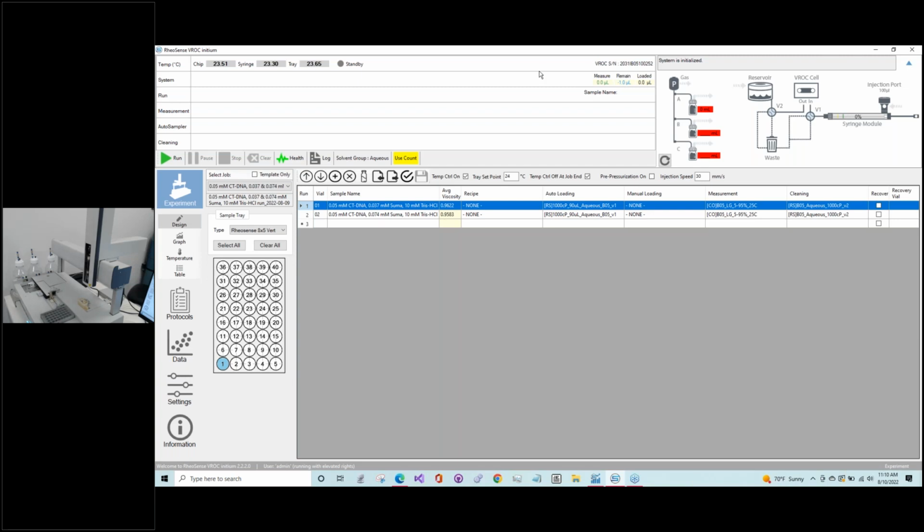So another thing we will check here from the software is this red over here. These are from our reagent bottles that we have connected to the unit. The reason why these ones are red is because the bottles aren't touching the sensor. We have larger bottles on this instrument, and so they do not fit into the sensors that are built into the Initium. Because the bottles are larger, we also had to put them on a platform of sorts. So the sensors are covered by the platform, and therefore it's not reading anything. That's why we have these red values here. And because of that, it's even more important to double check your solvent bottles to make sure that they are full and ready to use before you start testing.